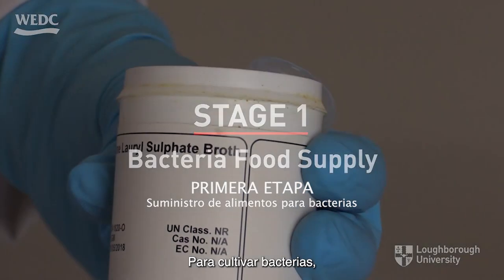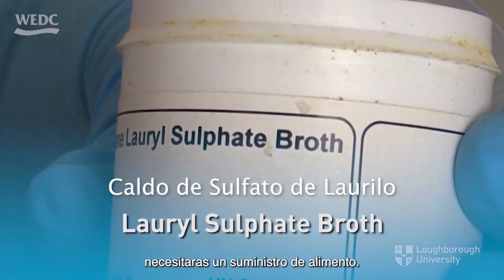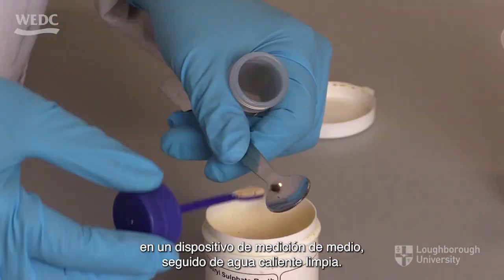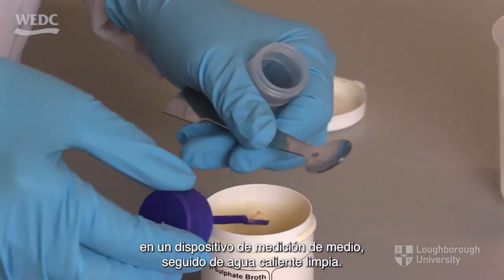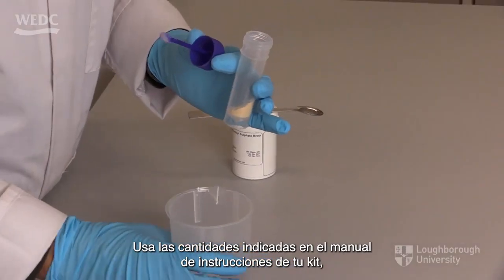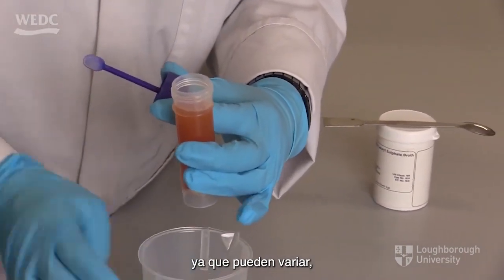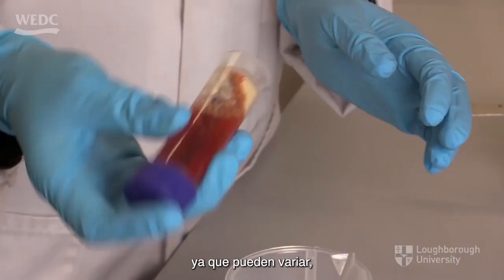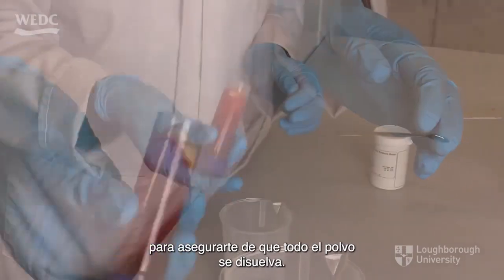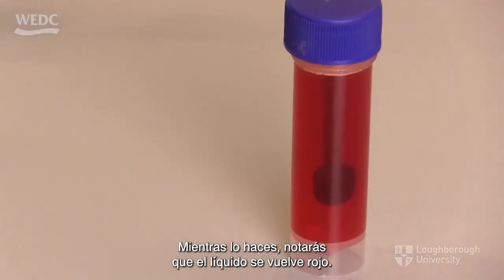To grow bacteria, you will need a supply of food. If you are to prepare your own, pour the membrane lauryl sulfate broth into a media measuring device followed by clean hot water. Use the amounts indicated in the instruction manual for your kit, as these can vary. Shake the media measuring device to ensure that all the powder is dissolved. As it does so, you will notice that the liquid turns red.